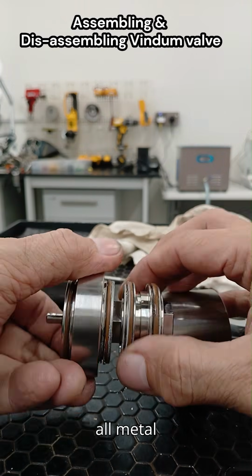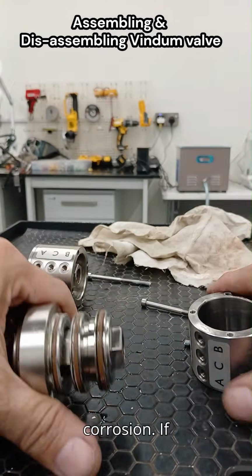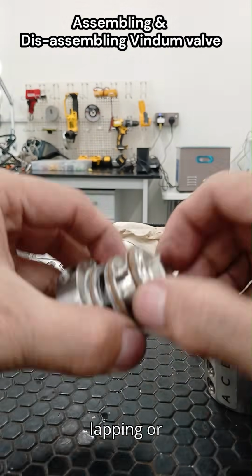Three, cleaning. Clean all metal parts with a non-abrasive solvent, isopropyl alcohol or compatible fluid. Inspect for scratches, pitting, or corrosion. If surfaces are damaged, they may require factory lapping or replacement.